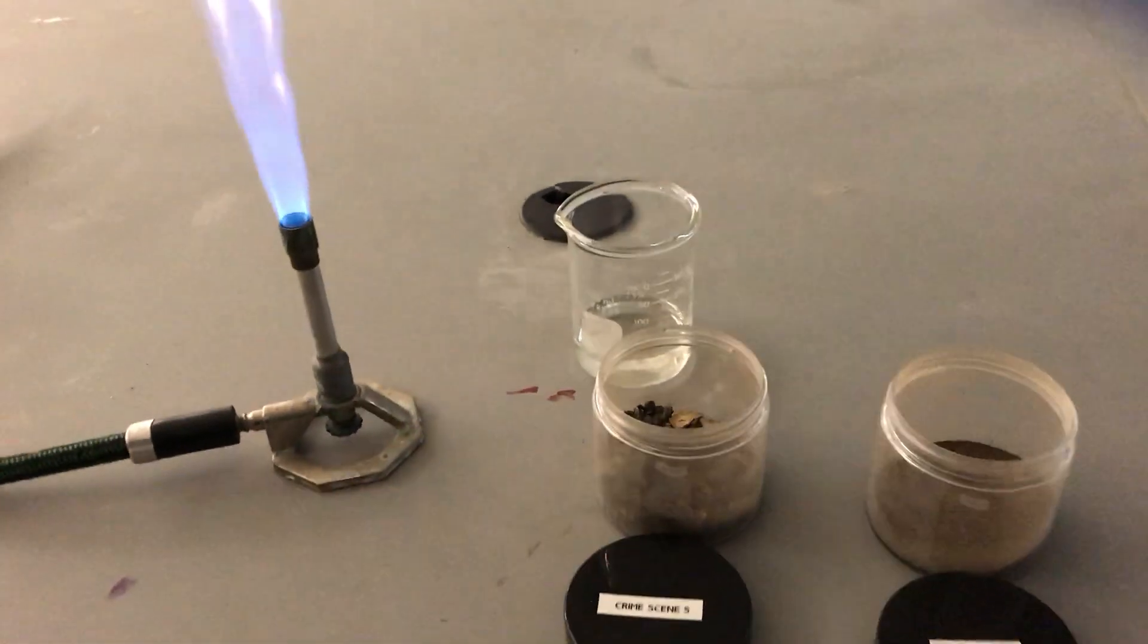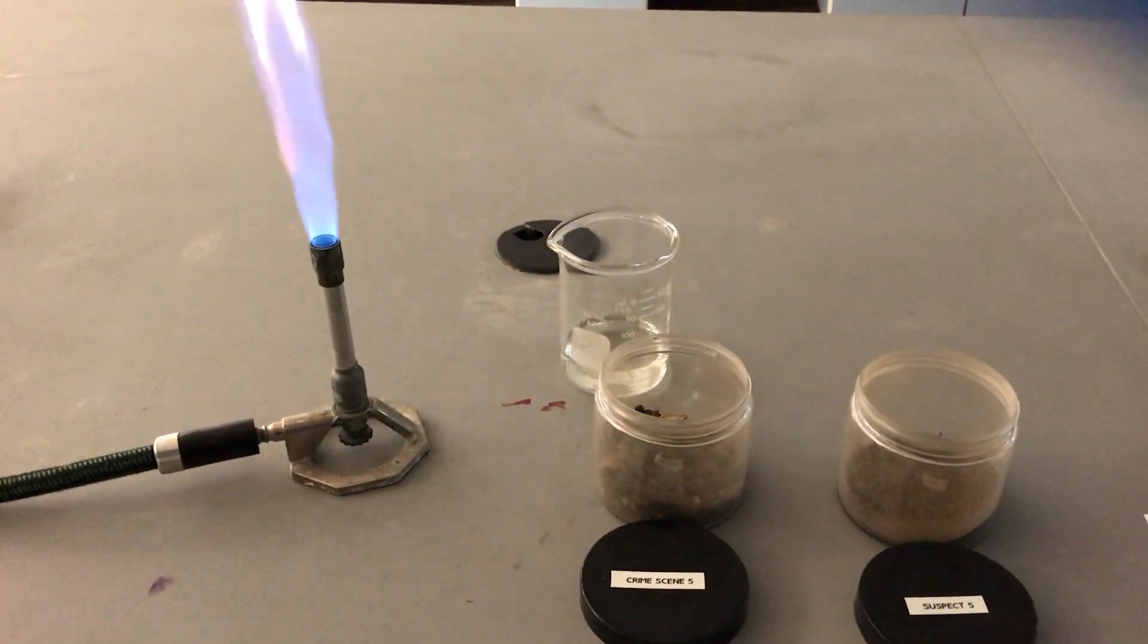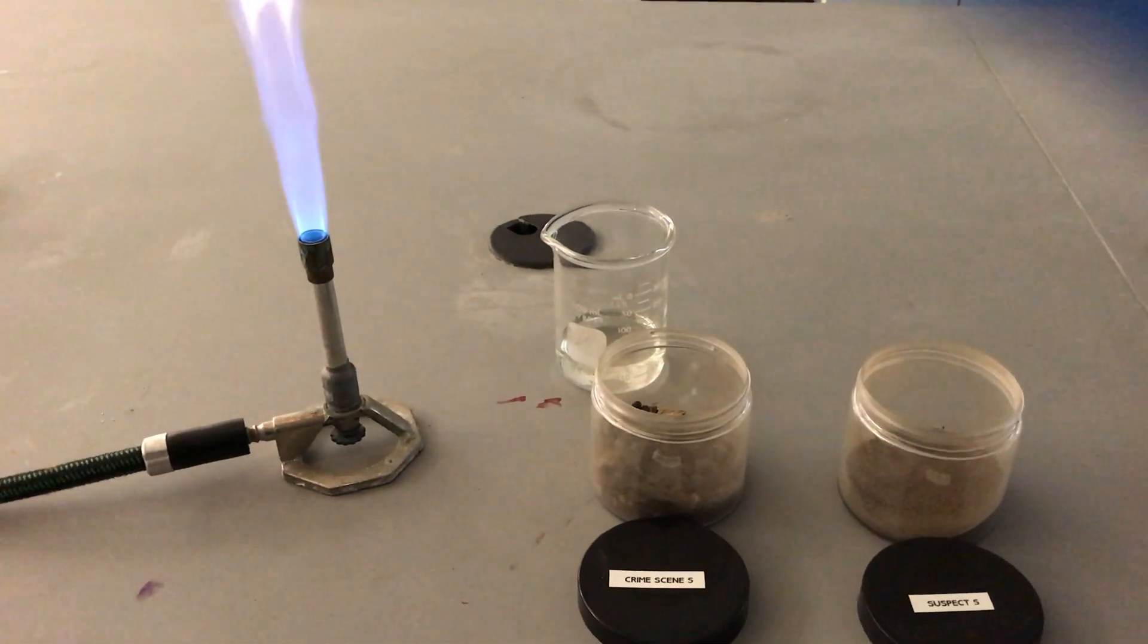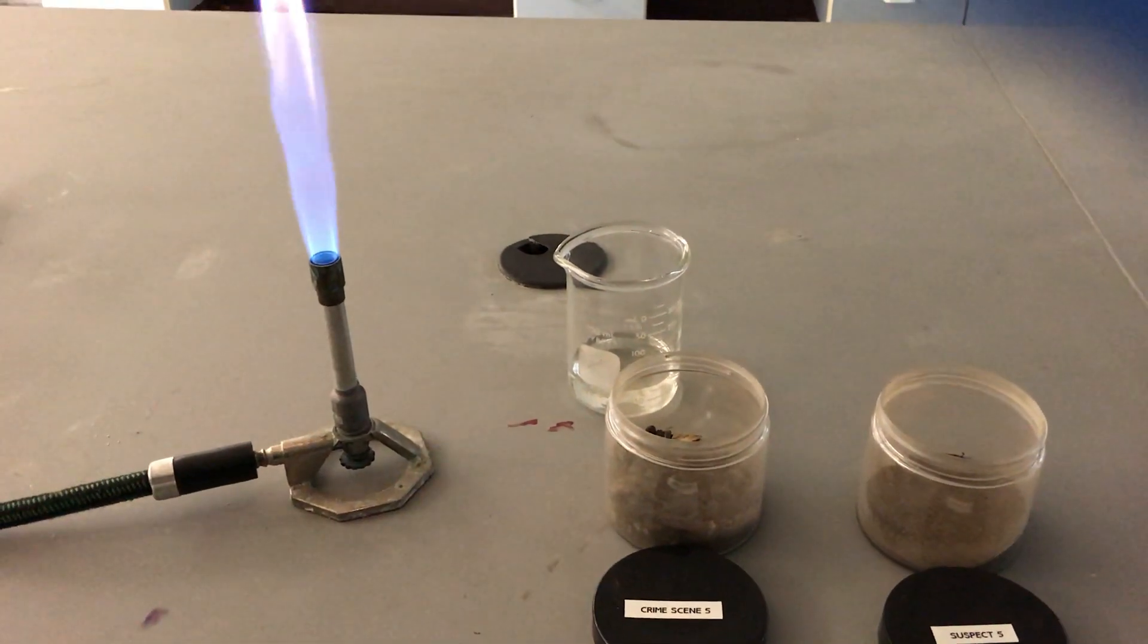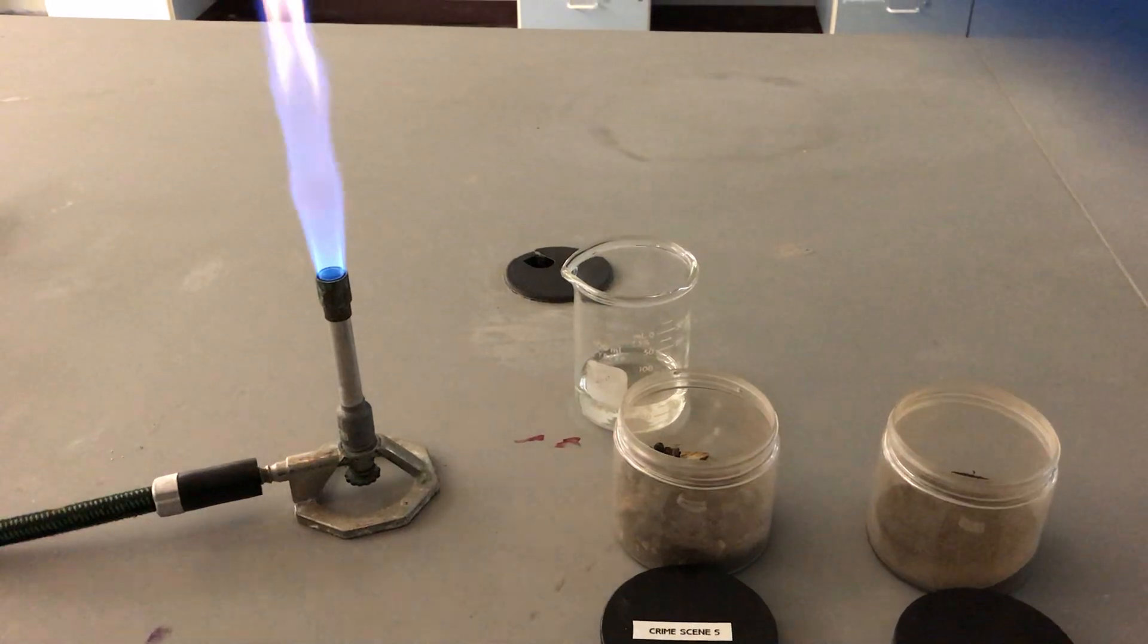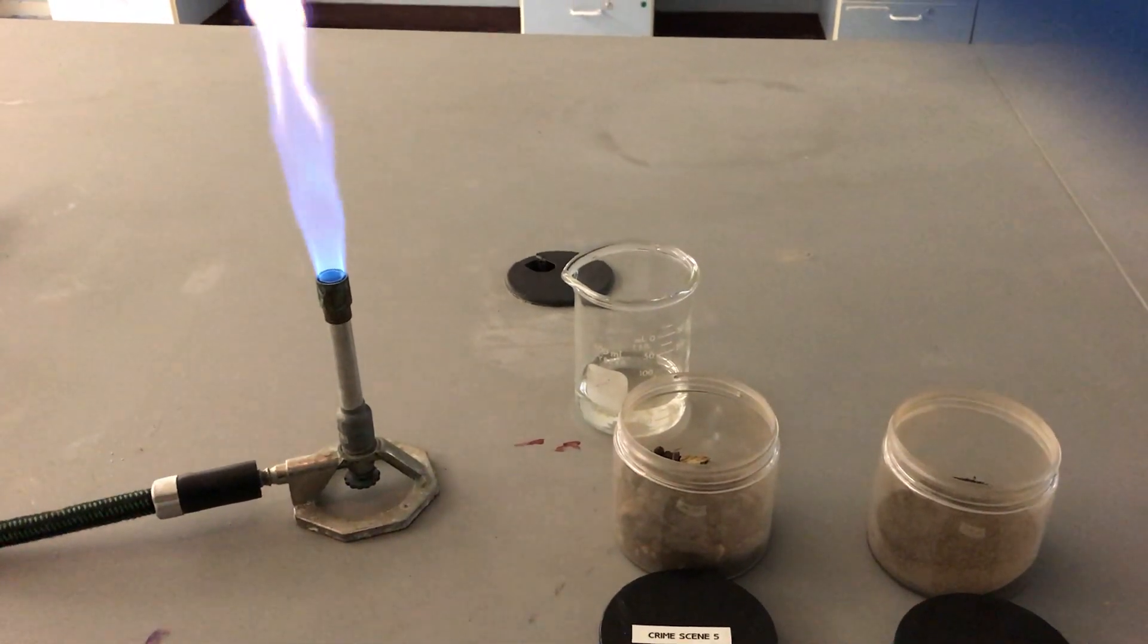Now I know what you're saying, why are we doing a flame test on soil? Well interestingly enough, the color that the soil burns when we subject it to the flame indicates the different minerals that are inside the soil.